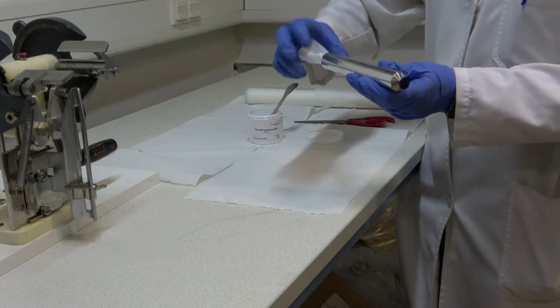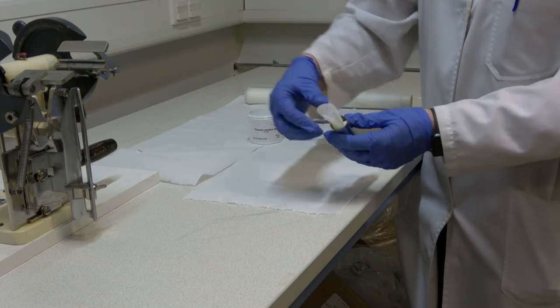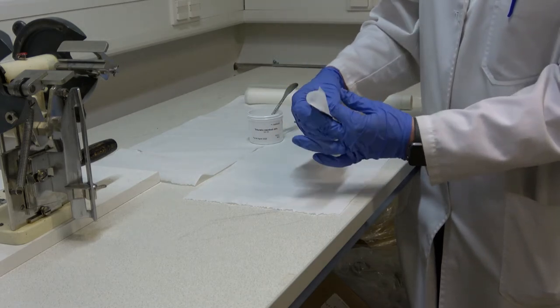When the paper reaches the bottom of the tube, the top opening is clamped together and tightly held with two fingers while the baking paper is pulled out. This leaves the product inside the tube.